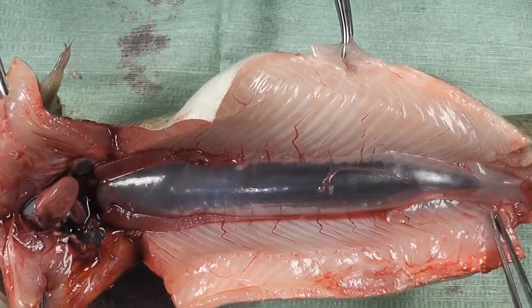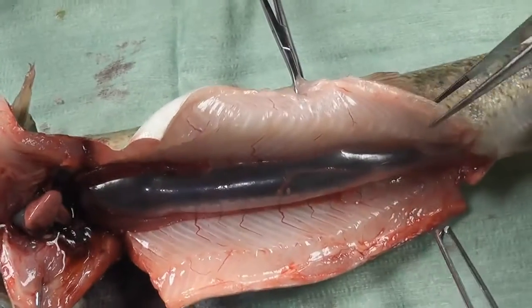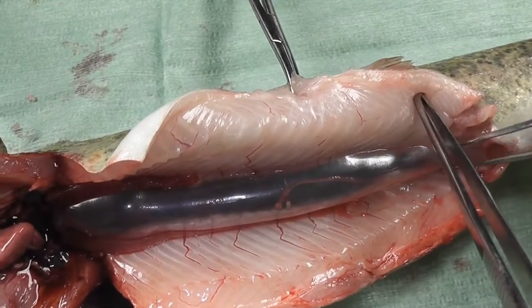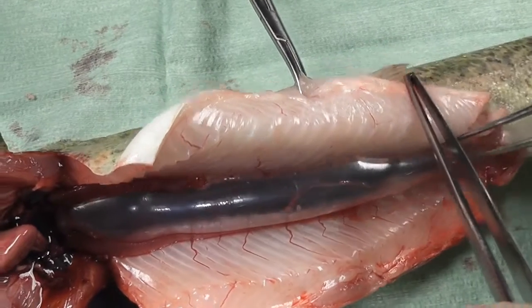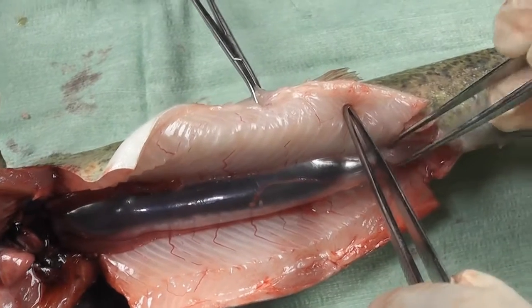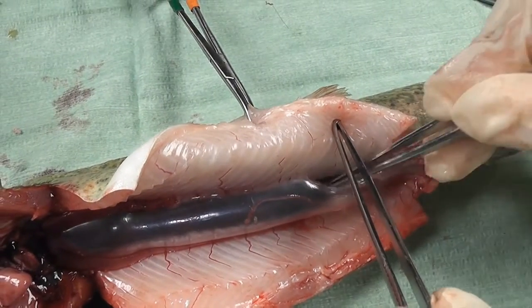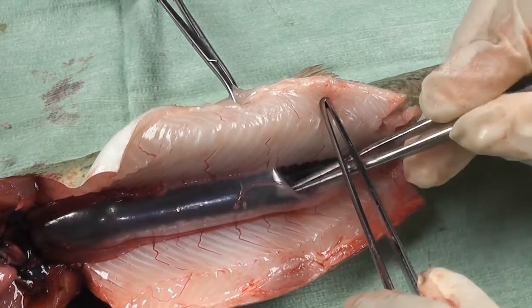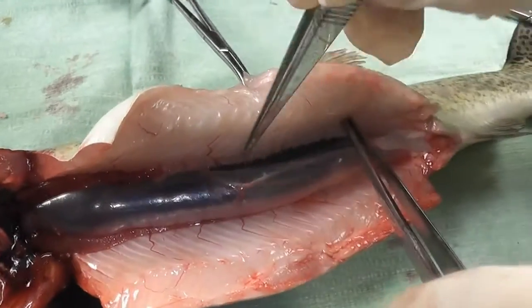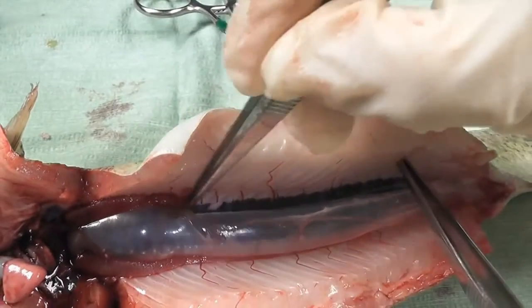The swim bladder is connected to the esophagus, allowing for gulping or rapid expulsion of air, a condition known as physostomy. Unlike many other physostom fish, trout do not use their bladder as an auxiliary device for oxygen uptake, relying solely on their gills. Now we can remove the swim or air bladder to observe the kidney without obstruction.